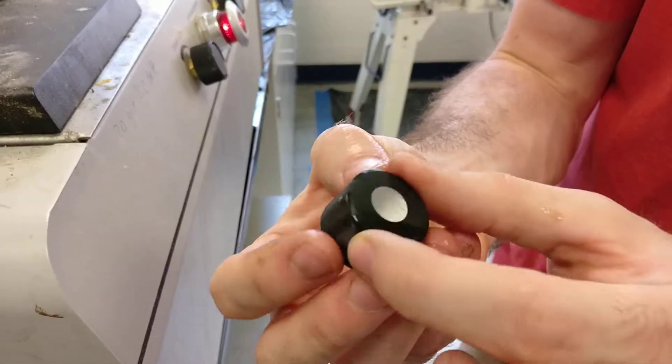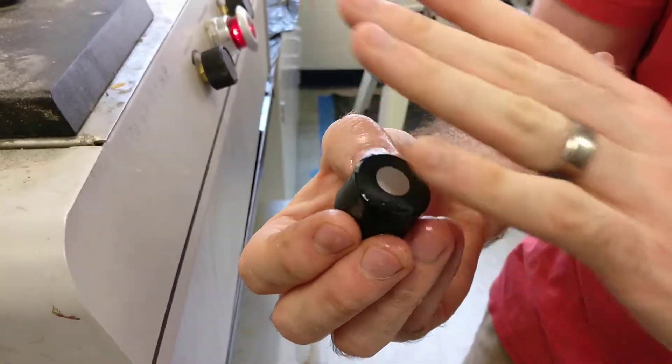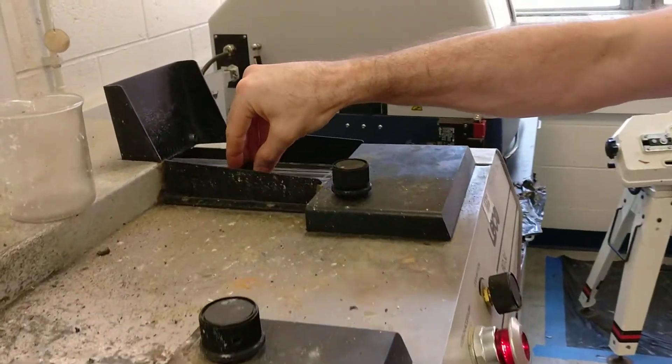Okay, so then we're going to turn 90 degrees. Hold your scratches across and put it on the next belt.